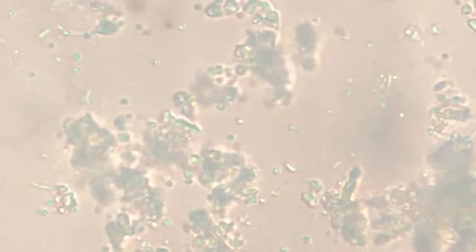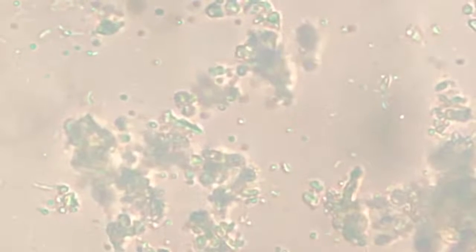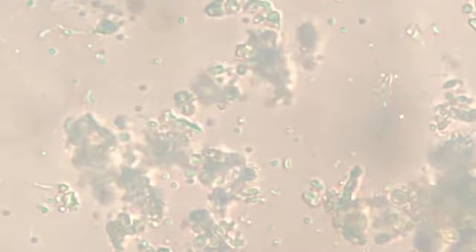No, it's not working. In any case, after this exercise, I will upload the video that I filmed through a better camera. The issue is with this camera, because the other camera was working very well, and I got this opportunity of getting a beautiful video. And at one point of time in this video, two amoeba happened to cross each other, as if they were walking on a highway. Bacteria. Yes, bacteria are apparently looking good, but the objective is amoeba.